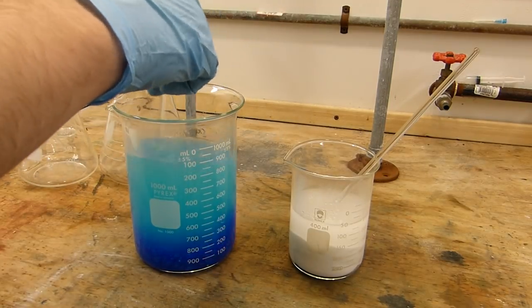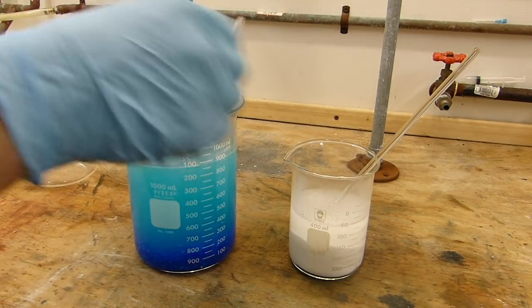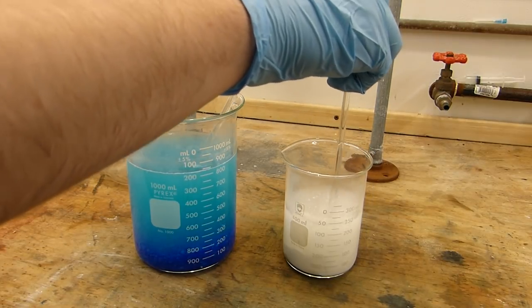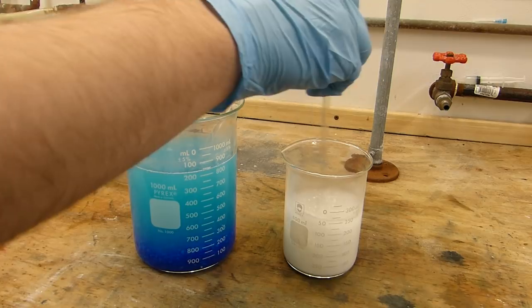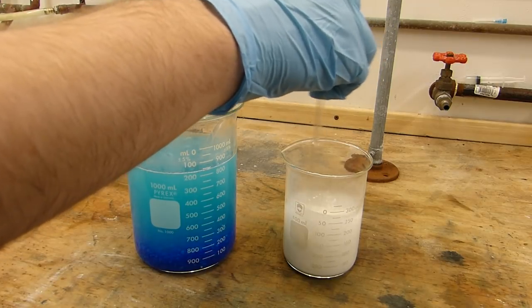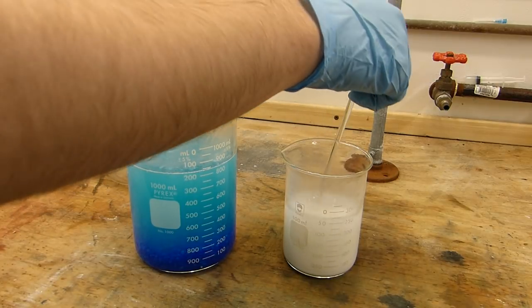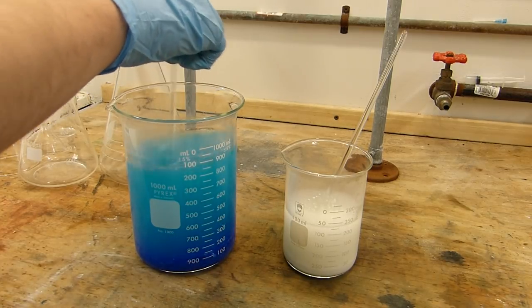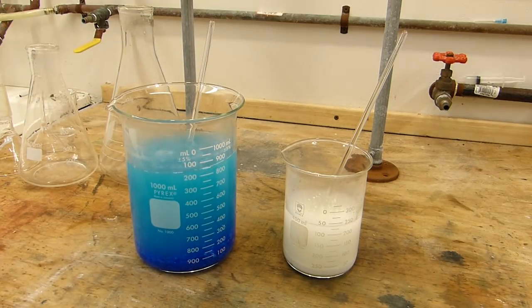And I'm going to dissolve the sodium carbonate in roughly 200 milliliters of equally warm water. And these will need some significant stirring and heating to get all of this in solution. So I will essentially get these stirring and then put them in the microwave and stir some more until they're both dissolved. I assure you, it will go into solution. So sit tight while I go do that.